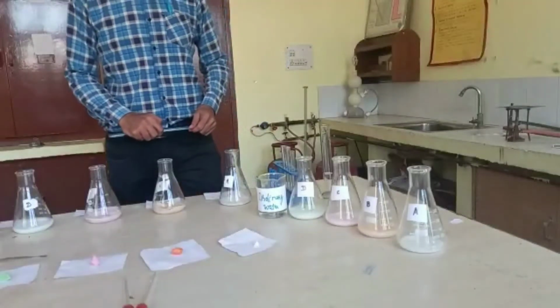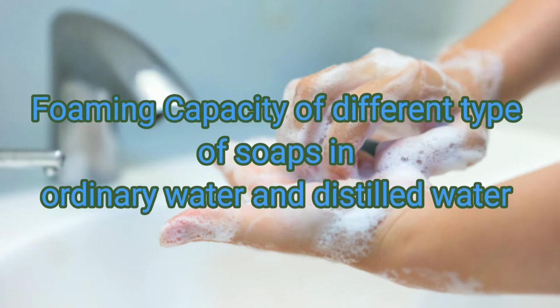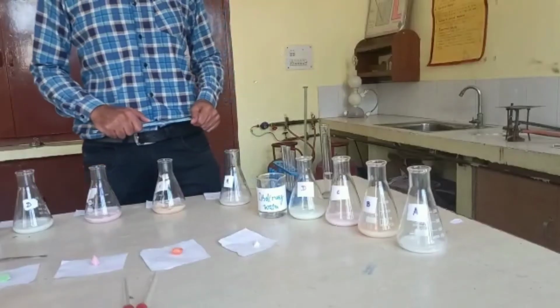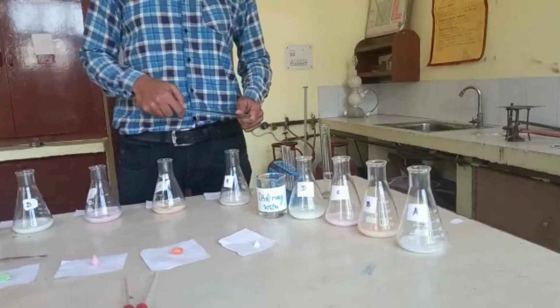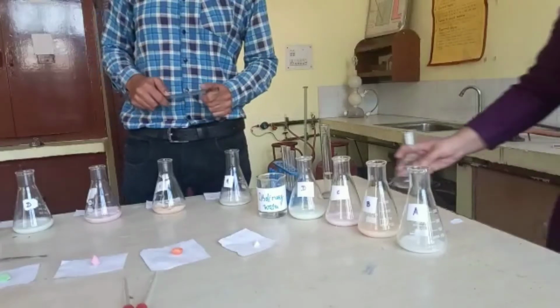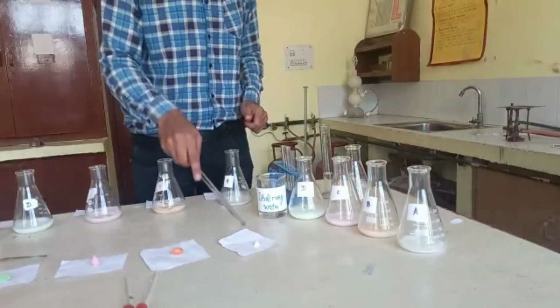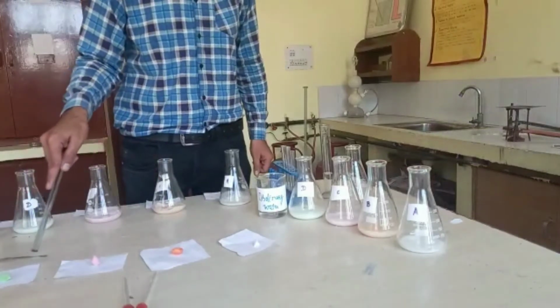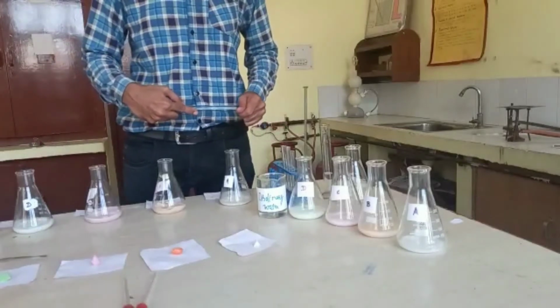Dear students, today's activity is the foaming capacity of different types of soaps in ordinary water as well as in distilled water. For this activity, the material required is 4 conical flasks for preparation of solution in ordinary water and 4 conical flasks for preparation of solution in distilled water. We also need 4 samples of different soaps of different brands to check their foaming capacity.